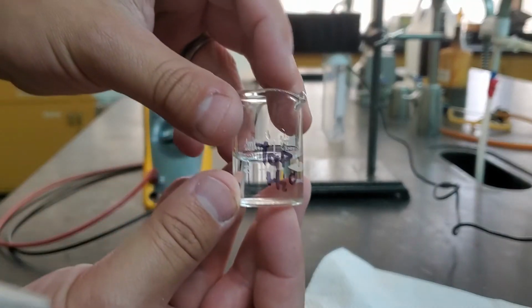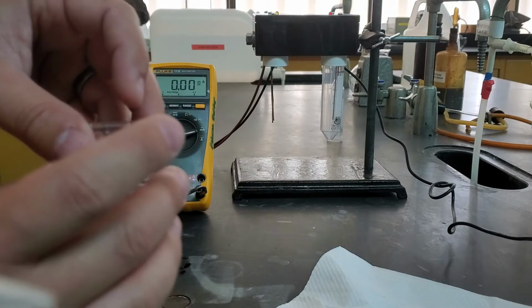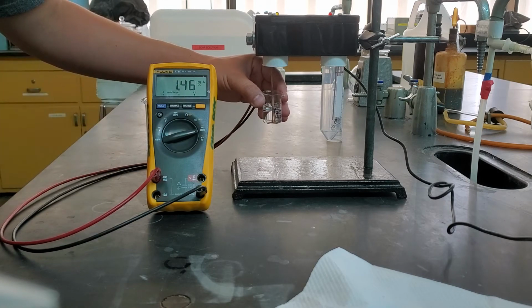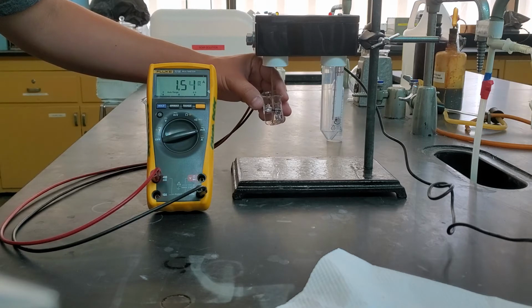So this case is going to be tap water. So this is just water straight from the tap. So not clean, not purified like the deionized water is. We can go ahead and put that one in. You can see we did get a different current here, 1.4, 1.5. So I might record this as like 1.56, right? 1.56, something like that. You could do like 7 and 8 maybe, depending. You just want to try to be consistent about it.